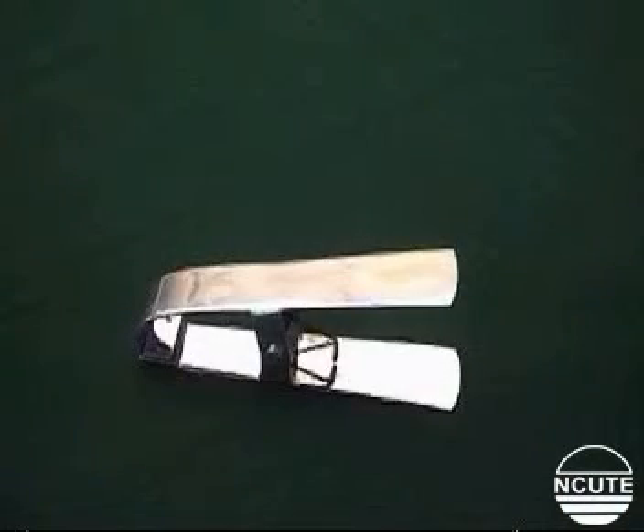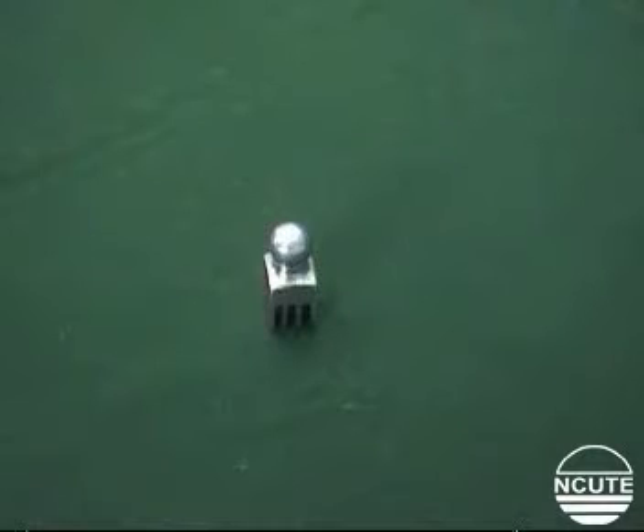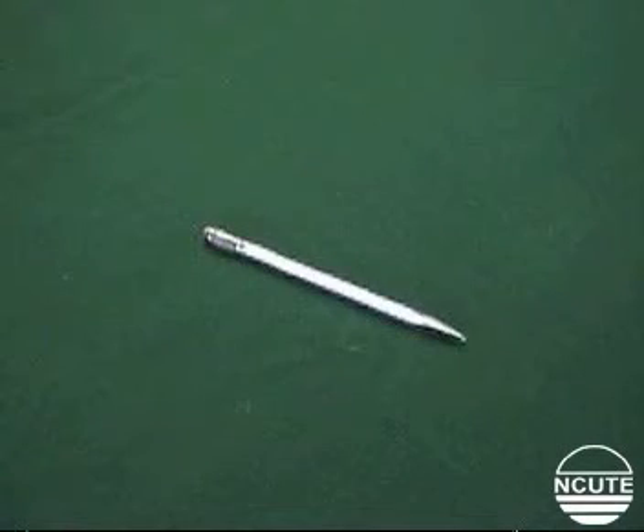Here are the associated accessories used in a test. This is a pair of tweezers to grip the fiber tuft. This is a depressor to press the fiber into the bottom combs. Here is a blunt needle that helps to hold the fiber tuft.